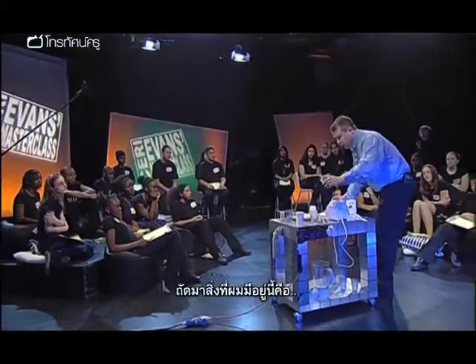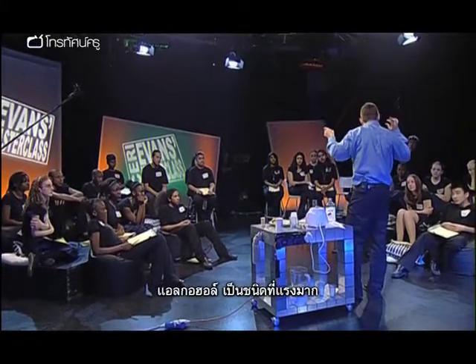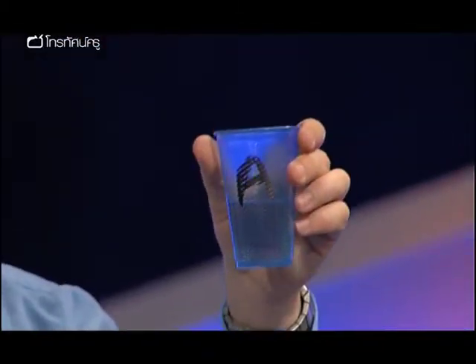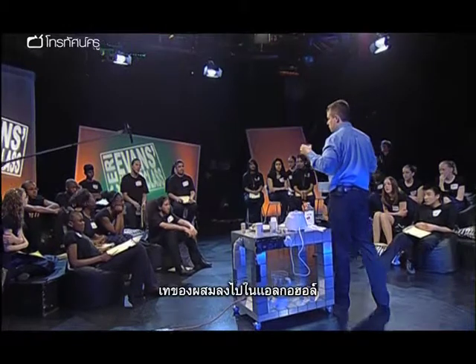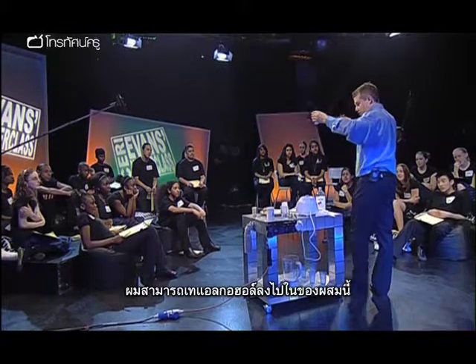What I have here is some alcohol. Very, very, very strong alcohol. Although DNA is soluble in water, it is insoluble in alcohol. Insoluble. So what do you think I can do to get the DNA out of there? Pour it into the alcohol. Very, very good. Or I could pour the alcohol into the DNA. Let's have a go at this.